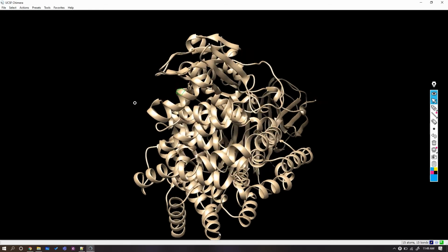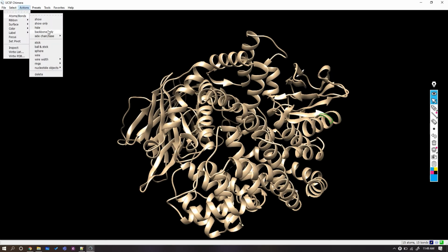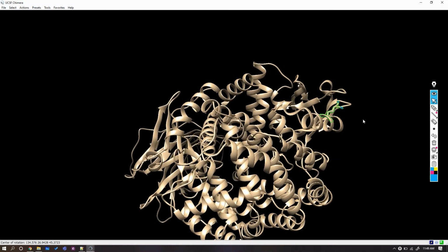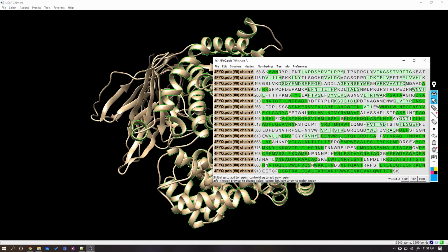So it is time to show the sticks for this residue. Sticks is another representation style. There you can see that it has two conformations, rotamers, at the same position, and these two horns represent the duplicate residues in different conformations.